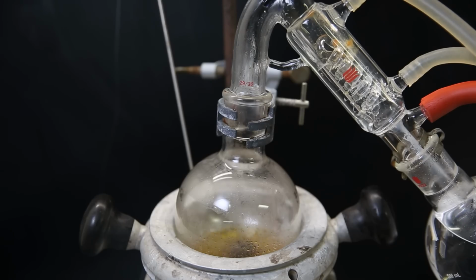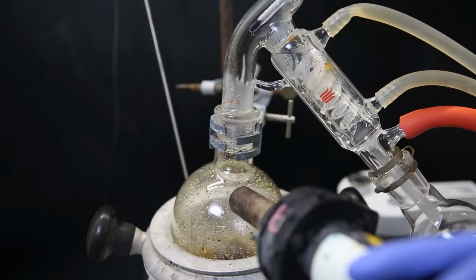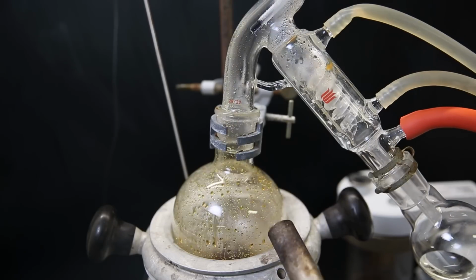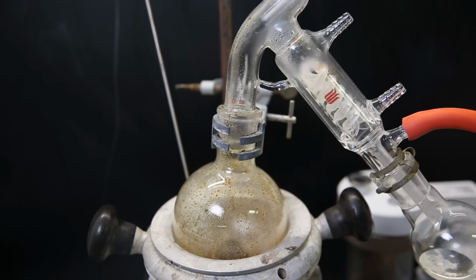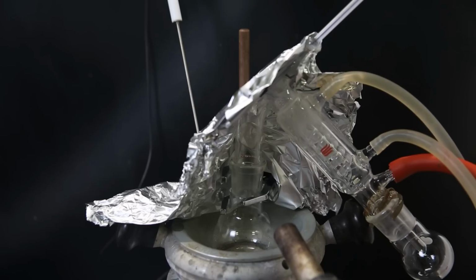So I increase the temperature and pull a strong vacuum to distill it all over. At first, a clear liquid comes over, but afterward, a solid starts forming in the condenser. The product should be a solid, but it seems most of this was just a liquid. So when the distillation was finished, I was left with a clear liquid, in which the solid slowly dissolved again. I then tried to redistill this liquid under a milder vacuum.